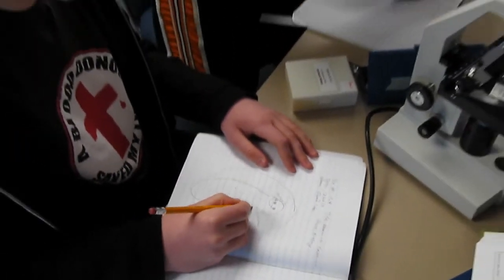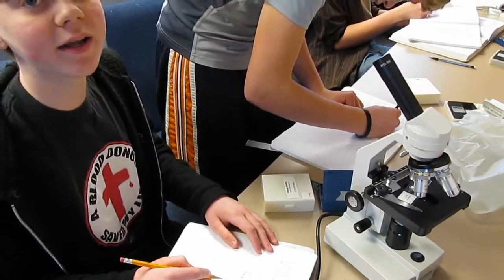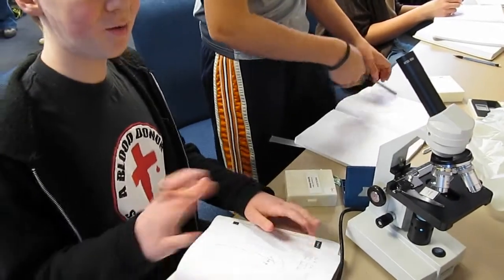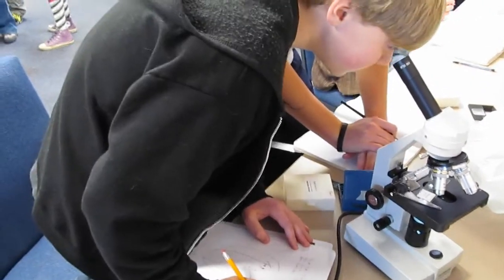What's his name? Are you guys doing the lowest magnification? Looks like you guys are. Yeah, we're not going to magnify. Are you supposed to? Does it say to?